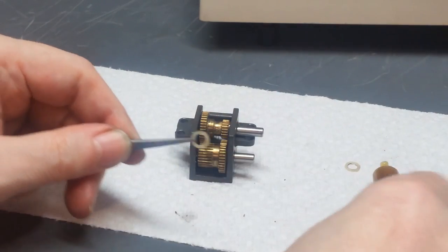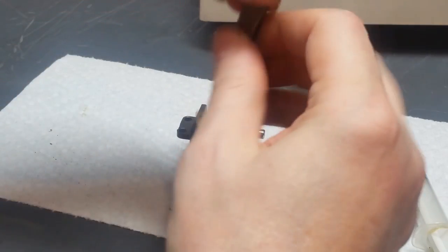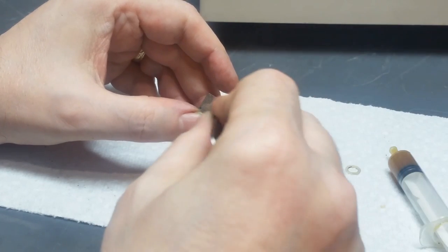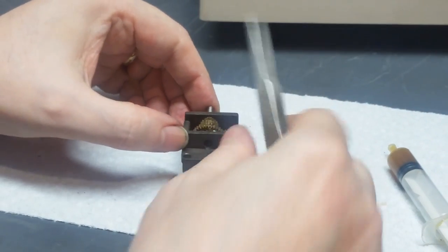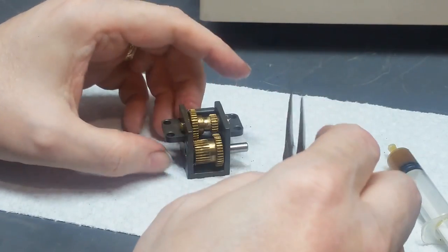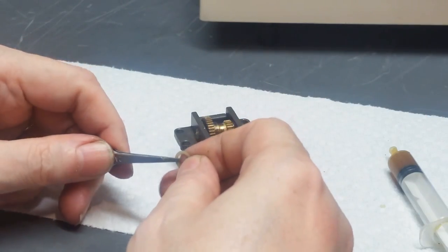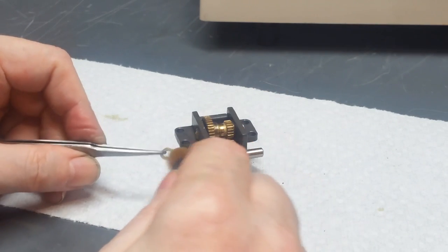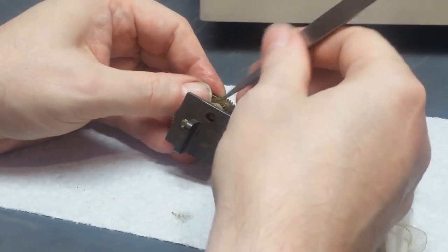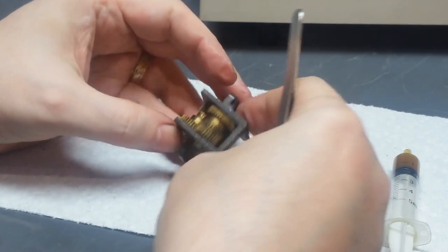Okay, now what I do is I take each of these two remaining thrust washers, put a little grease on both sides, and I take the first one and slip it in, reach the tweezers in, and align it so everything's lined up. And if I have everything properly lined up, I can push the pin all the way home. Of course, there's grease everywhere. Don't worry about that at this point. And now I do the same thing with the remaining thrust washer, and it goes in the end of the other gear. Push it in place, reach through and line it up so that the shaft doesn't damage it when I push it in, and that's good.